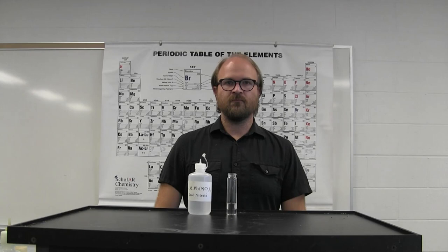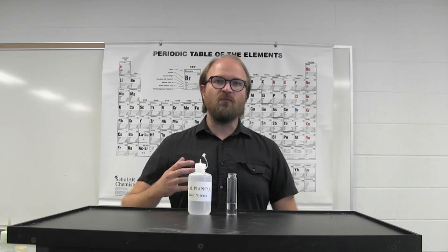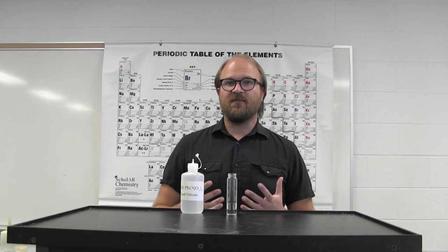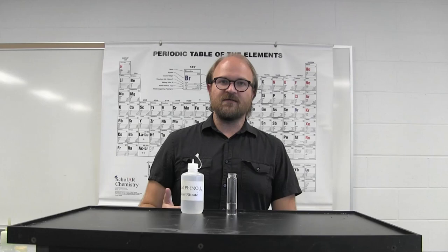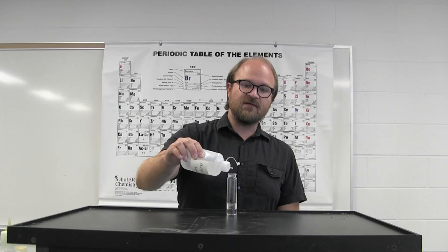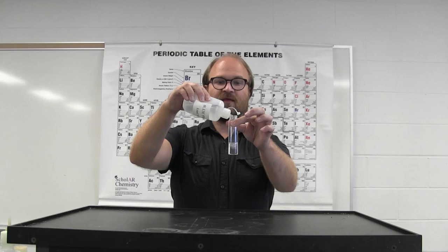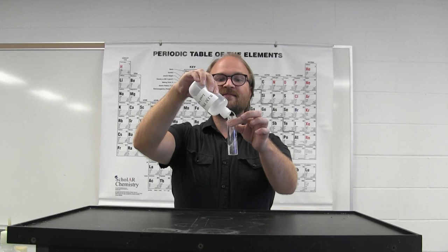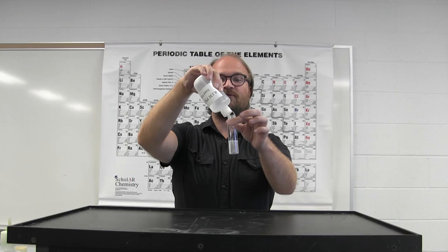Solubility relates to how much of a solid can dissolve in water. In the reaction of lead nitrate with sodium chloride, the solid produced is lead chloride, which is slightly soluble in water. At low concentrations, the precipitate forms and then quickly dissolves as it is below the solubility limit. However, at higher concentrations, the precipitate stays longer and eventually produces a fully cloudy solution as the solubility limit for lead chloride has been reached.